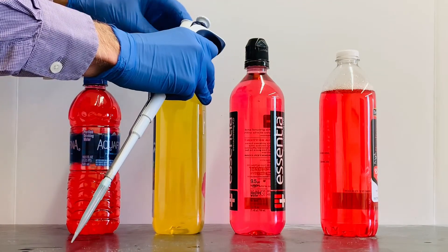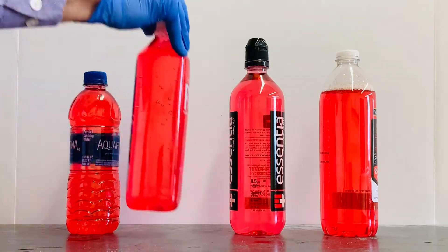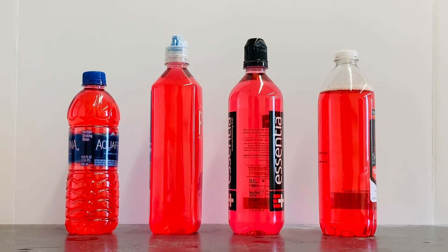Finally, I'm going to add to the Fiji water the amount of acid your stomach makes in just two minutes after having a meal. Well, it looks like your stomach has no problem producing the acid needed to neutralize every one of these brands of water.